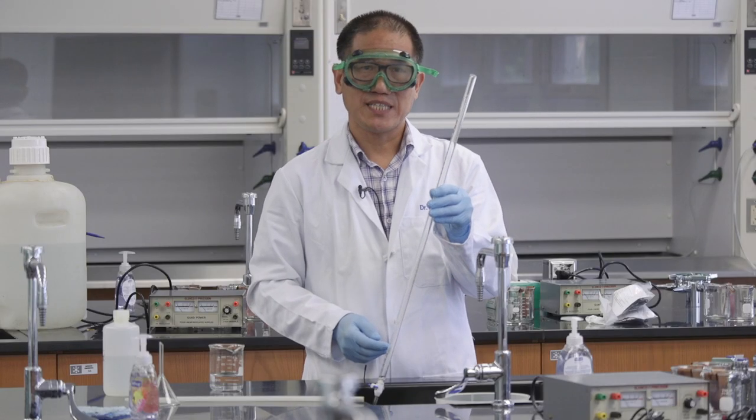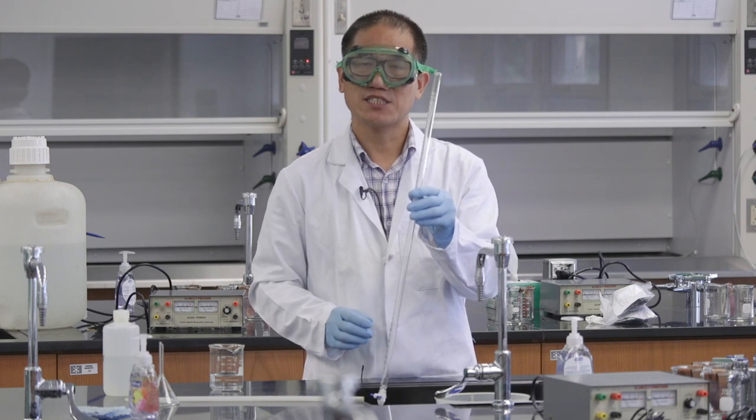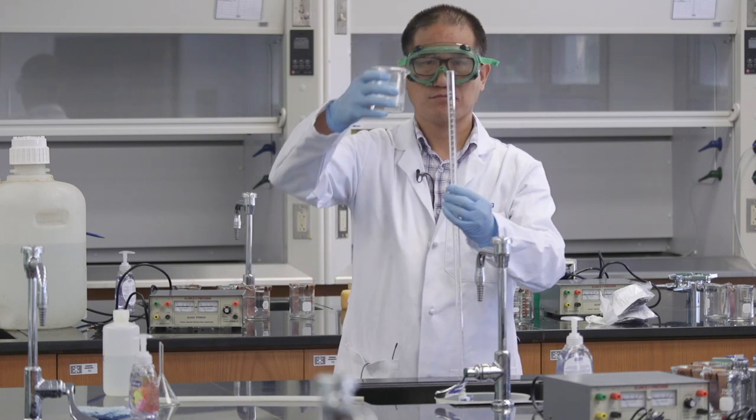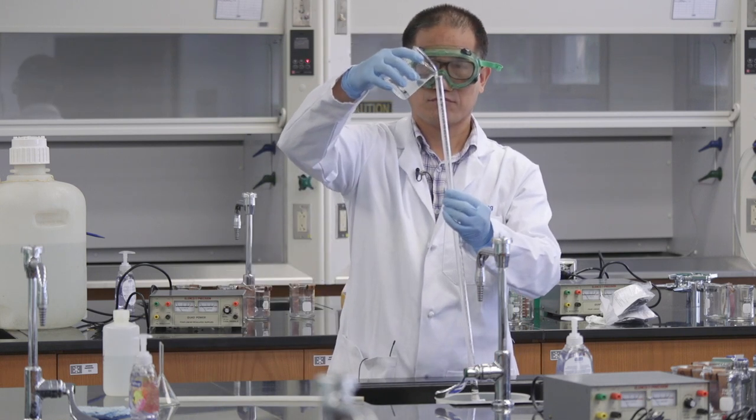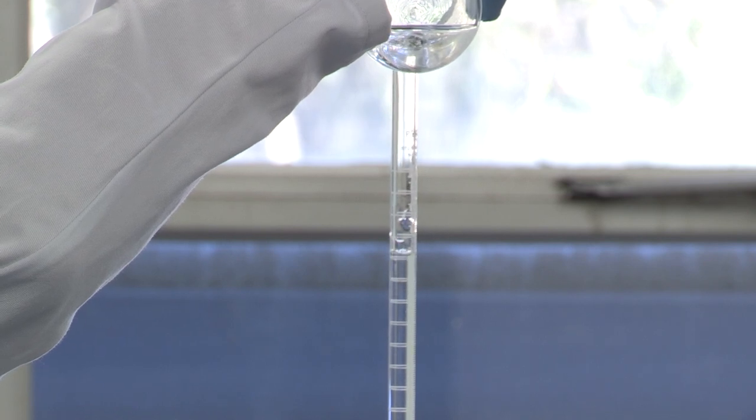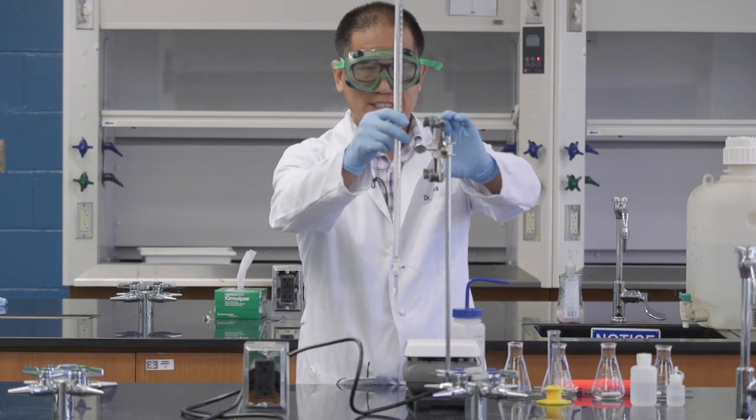After this burette is rinsed with sodium hydroxide solution three times, now we can fill this burette with the sodium hydroxide solution. Then, let's clamp this burette on the stand.